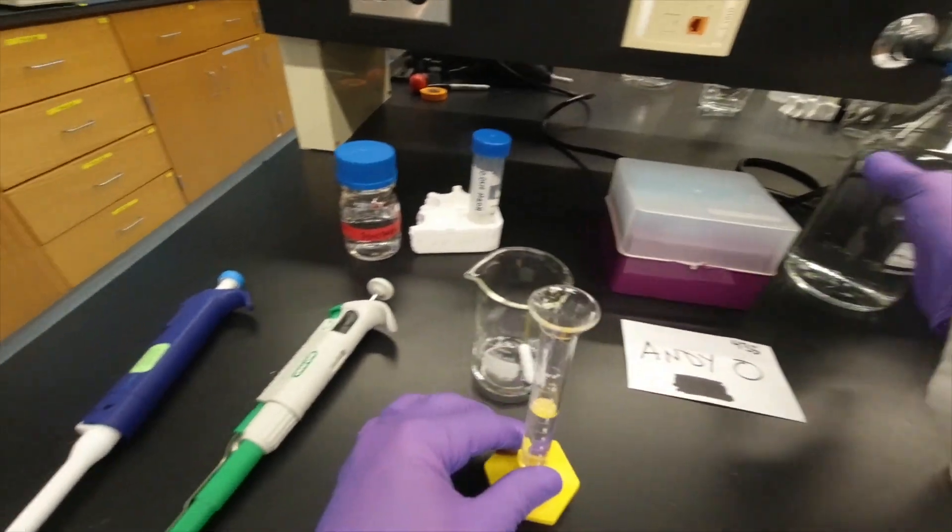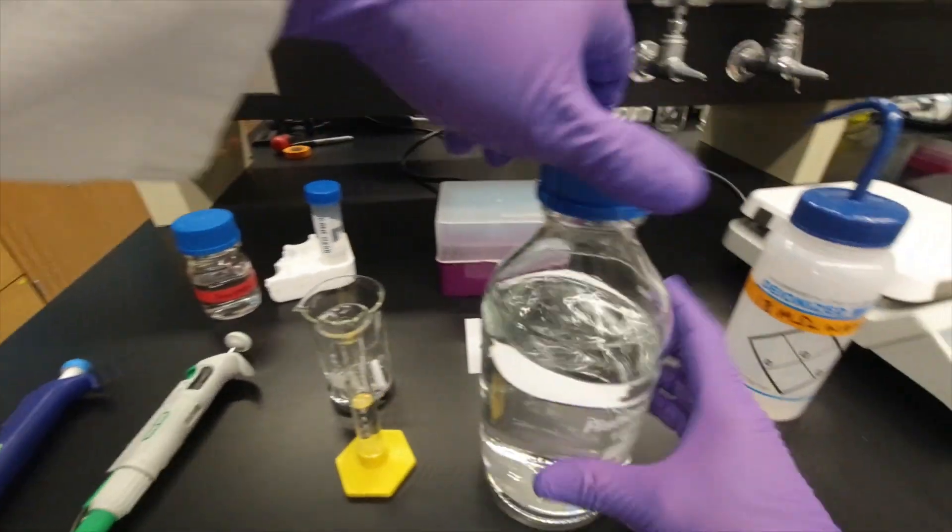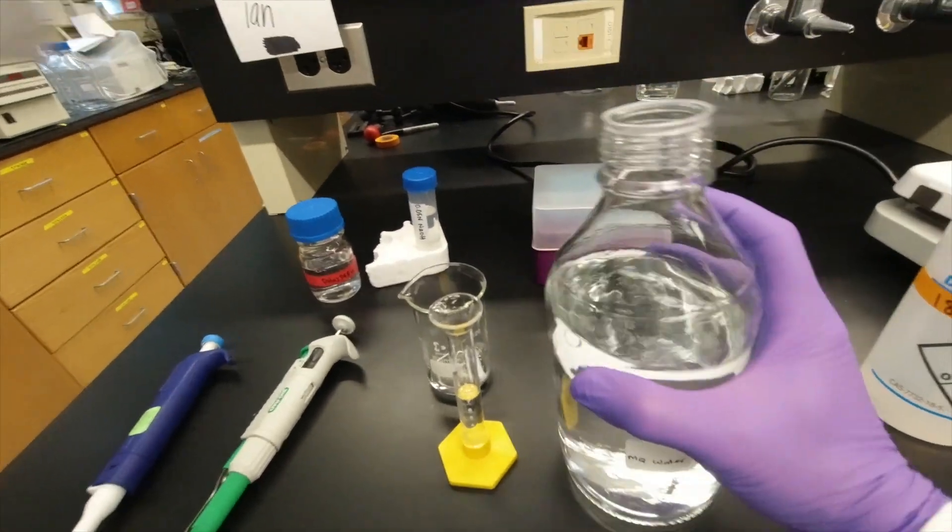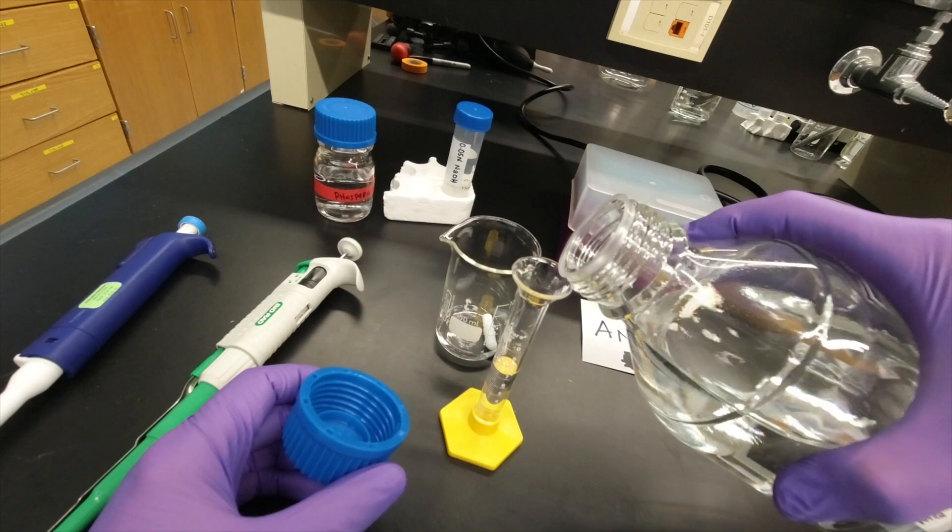You can also use this, which is your milli-Q water as well. And if you feel more comfortable, you can do this.